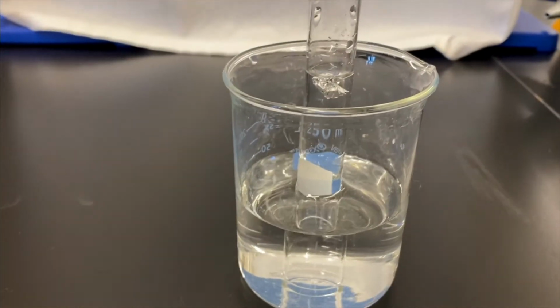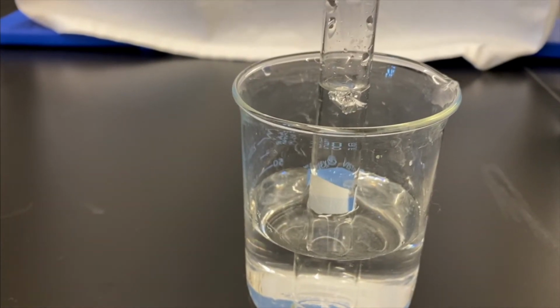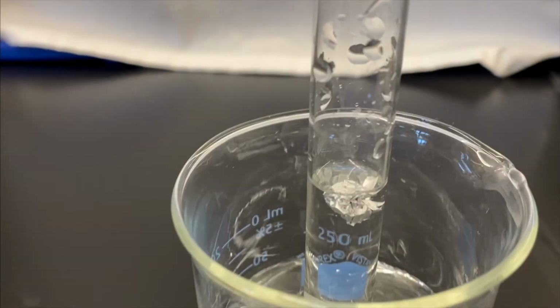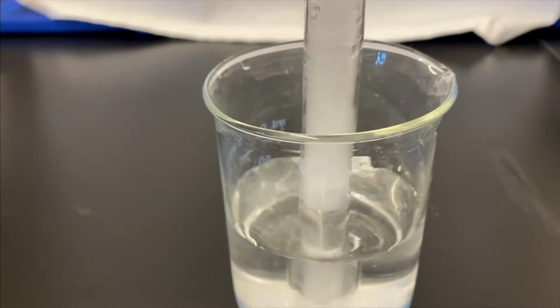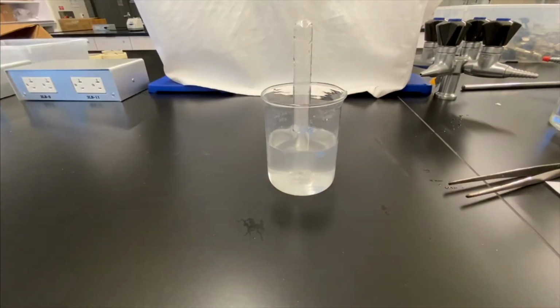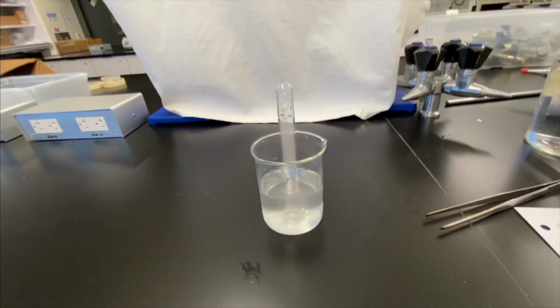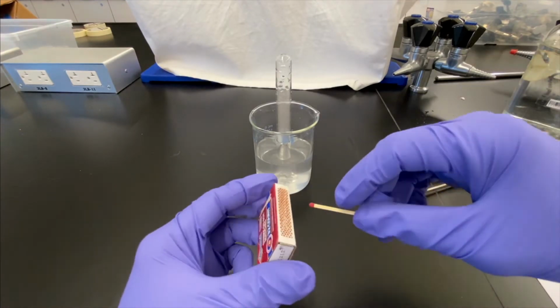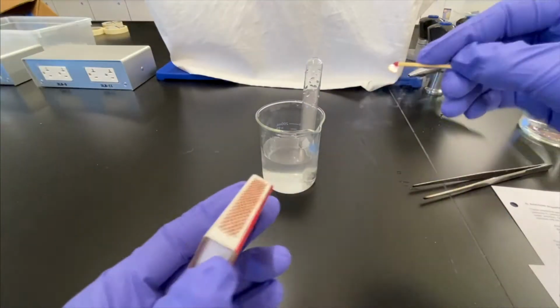It's pretty cool. And since we put it in tin foil and there's kind of that oil layer still around it, it's going to cause the sodium to react slower than it normally would, but that's just a safety precaution. And again, this is sped up, but pretty cool. You can see as that hydrogen gas, and there's a lot of it, is being produced, it actually pushes the water layer down. I think part of that also is usually these metals will form oxides on them. And once you start getting into it, now you have a bunch of fresh metal on the outside to start reacting, so it kind of speeds it up.